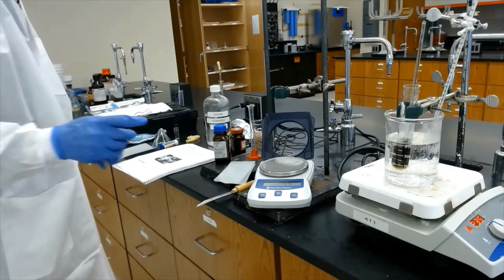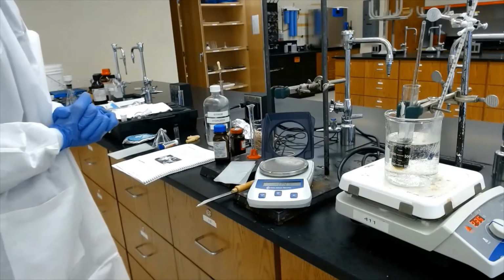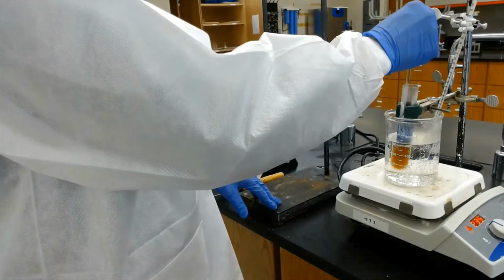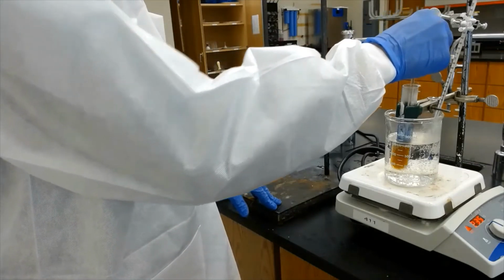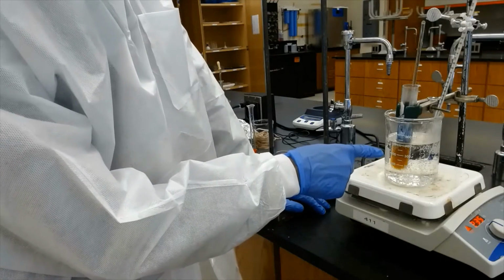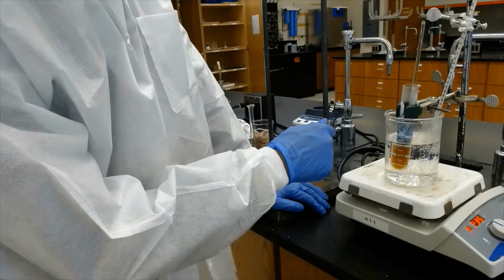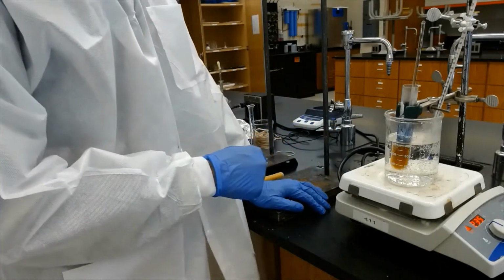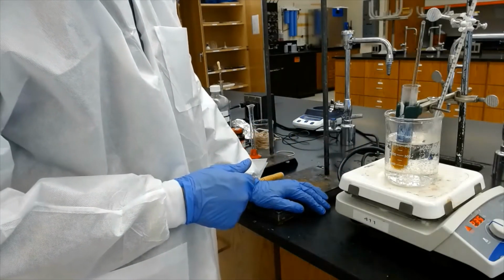So while this is cooking, let's just take a 250 milliliter beaker, add about 100 milliliters of water. Okay, so as you can see, the deep blue color of indigo is gone, and the sodium dithionite reduced that indigo to this soluble indigo, sometimes referred to as a leucoform, L-E-U-C-O, leucoform. That's referred to as the soluble dye.